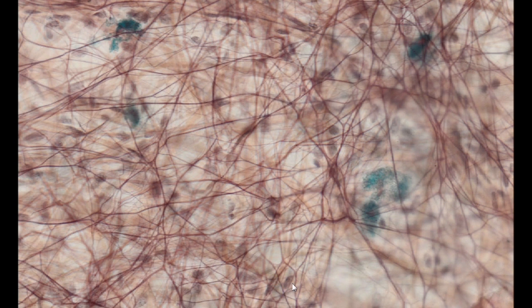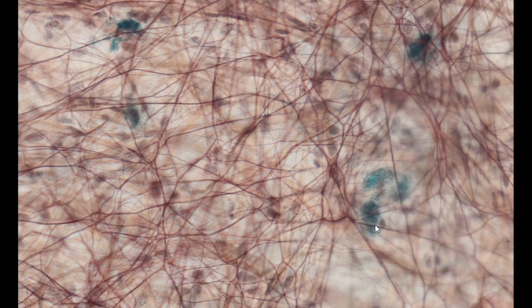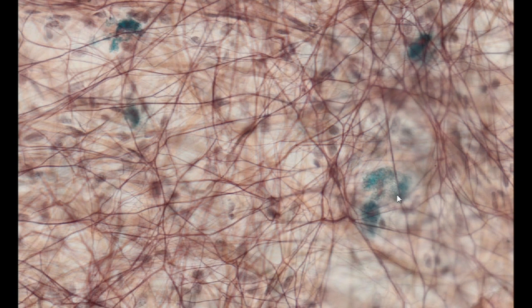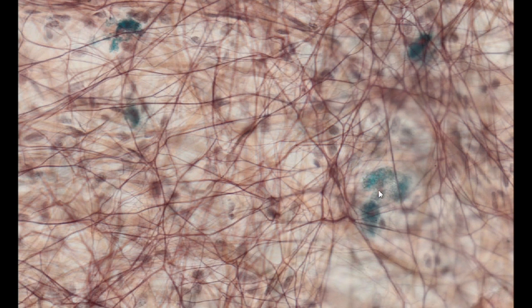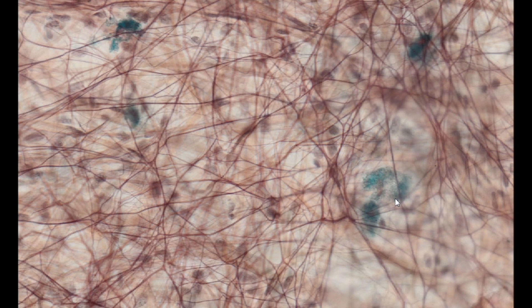Toluidine blue stained mast cells are cells whose identification raises no doubts. They are involved in the mechanisms underlying non-specific responses, responsible for the rapid development of inflammation at the site of infection, as well as specific defence against pathogens.